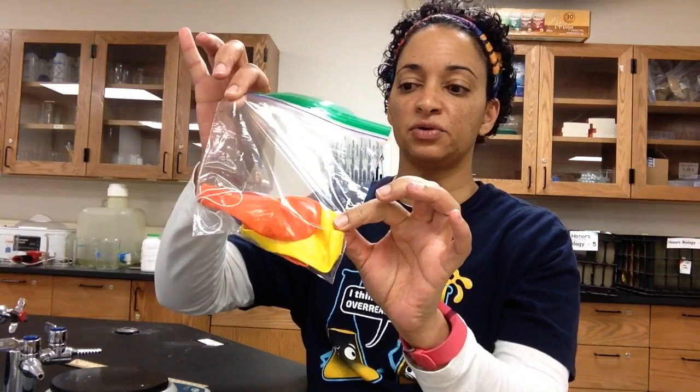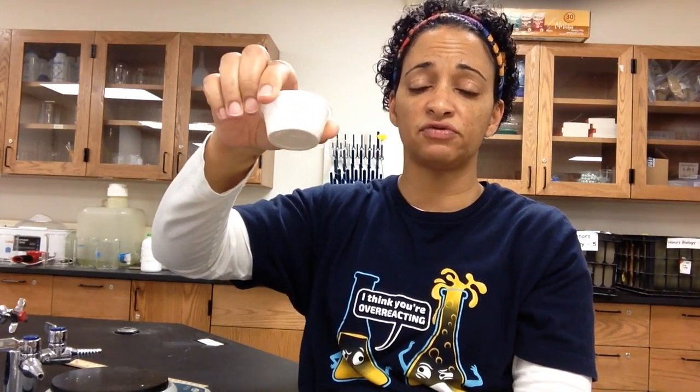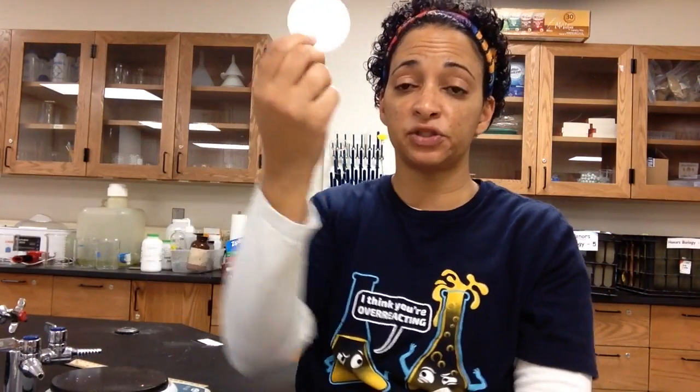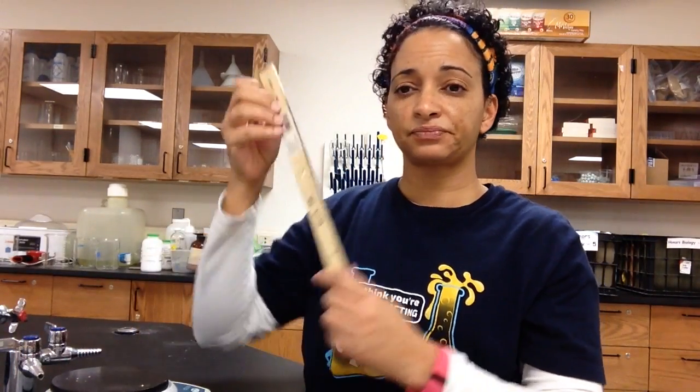When you get back to your lab, you're going to see you have a baggie with five balloons in it and a piece of string. You also have a little sauce cup with exactly five grams of yeast — enough for your five balloons. You want to make very good measurements. I have an empty sauce cup as my tare cup — remember back to the gummy bear lab — and I have a balance, a ruler, a sharpie, and a graduated cylinder.